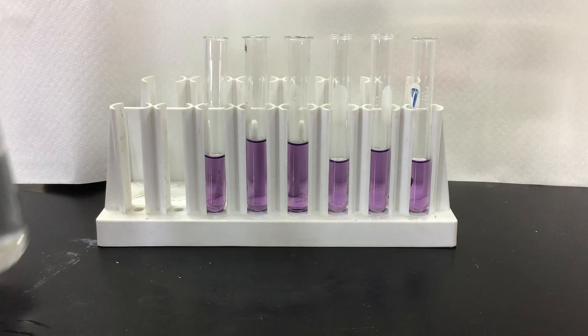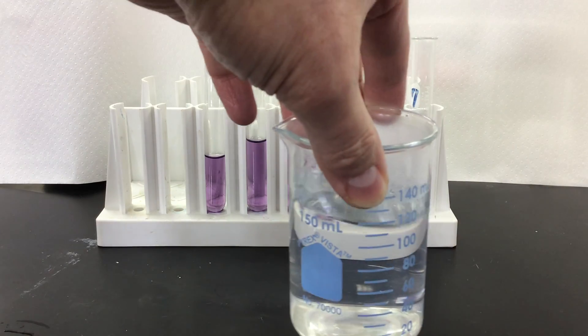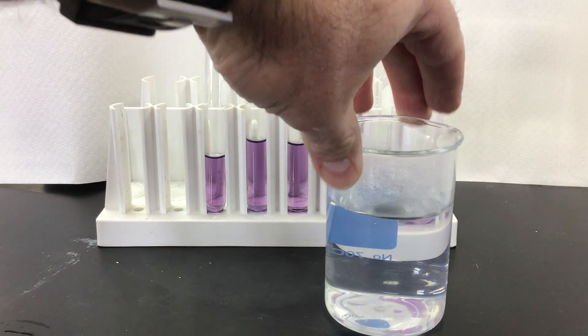First thing we're going to do, I've got some hot water in a beaker and we're going to see how the equilibrium may be affected by temperature.